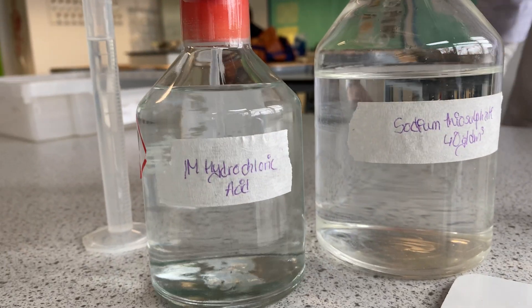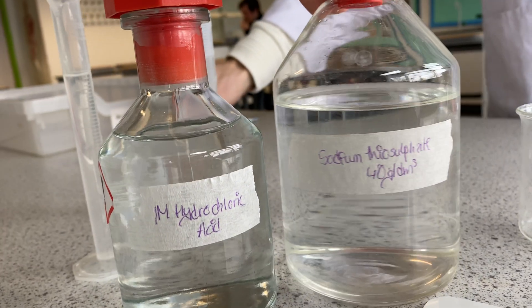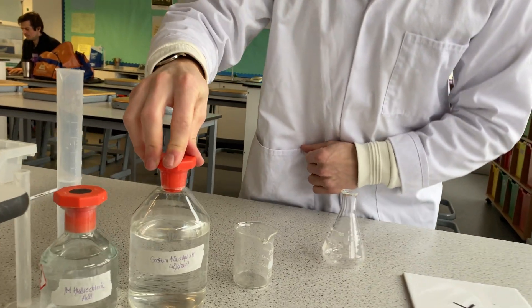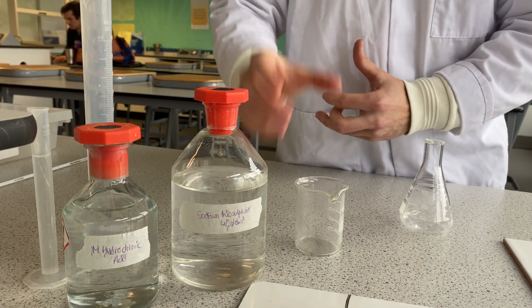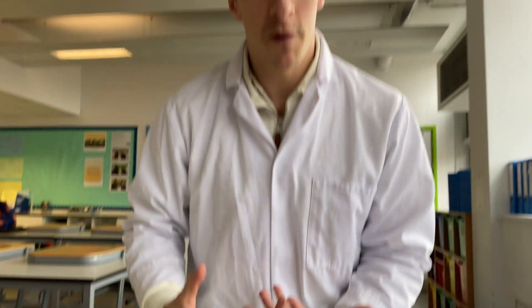We have hydrochloric acid and sodium thiosulfate solution. The point of today's experiment is to look at how temperature affects the rate of the reaction. We're going to react the hydrochloric acid with the sodium thiosulfate. When they react together, they produce sulfur, which is going to be a solid in solution — what we call a precipitate.